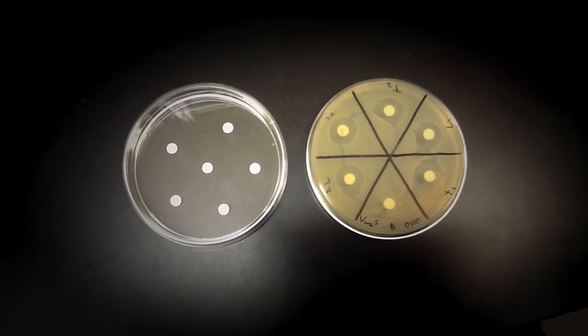Easy! To test the efficacy, we'll be using a modified disc diffusion assay, also known as a Kirby-Bauer assay.